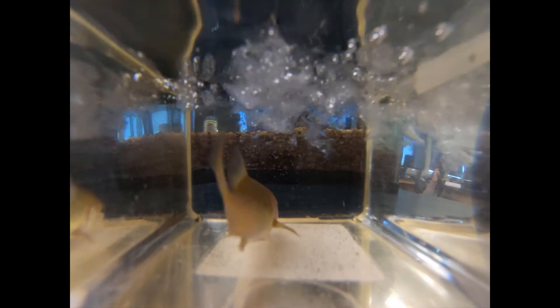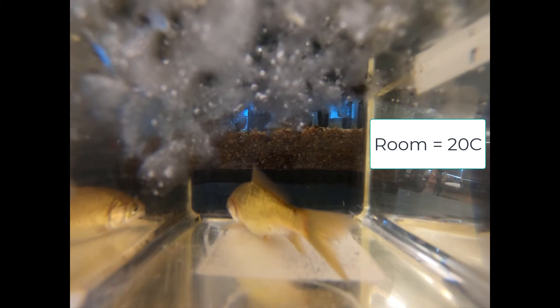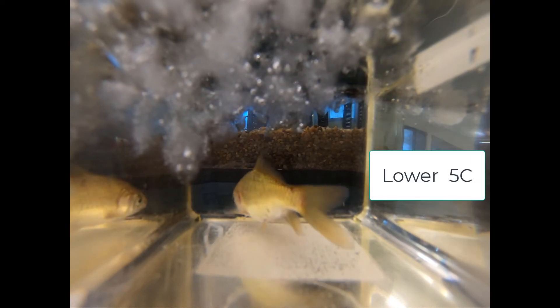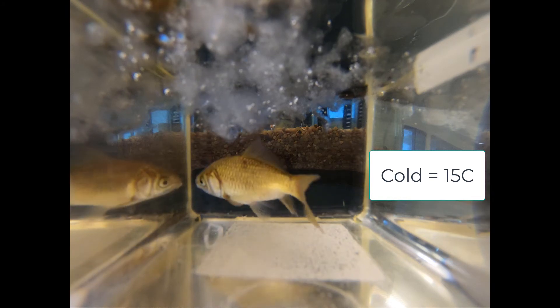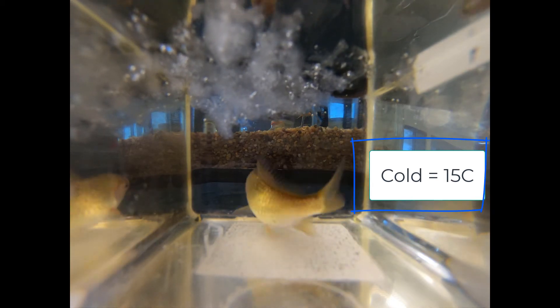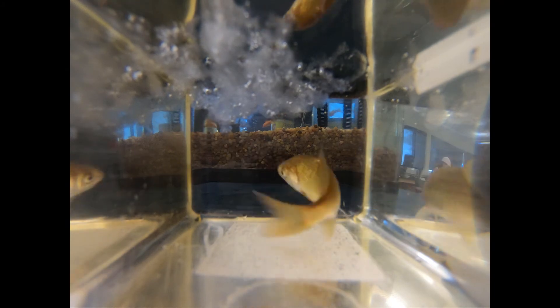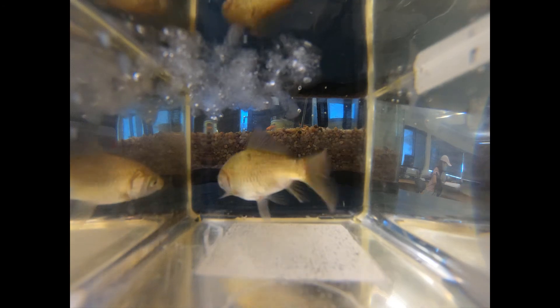If you're actually doing this in class you can move around and adjust. Now we're going to add ice to the container — our room temperature water is about 20 degrees Celsius. We'll add ice to lower the temperature five degrees Celsius, so our goal is to bring the water down to 15 degrees Celsius, then give the goldfish a couple of minutes to adjust metabolically before we start trial number one of the cold condition.